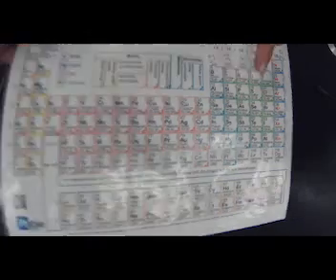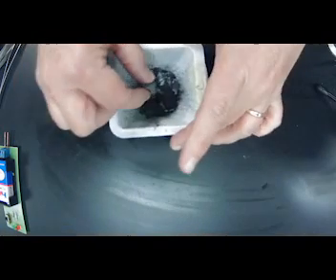So if it's a non-metal, does it have mobile valence electrons? It's not a metal. And what should we see? Should we be able to do this? So it's a non-metal. So there's my carbon. And I'm going to put it on this white piece of paper.